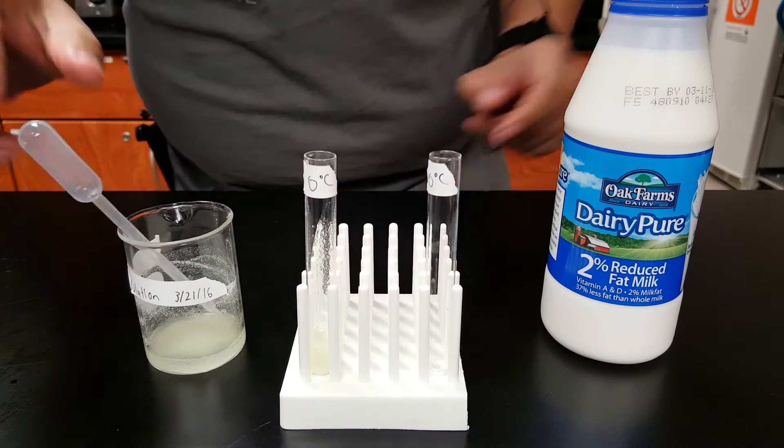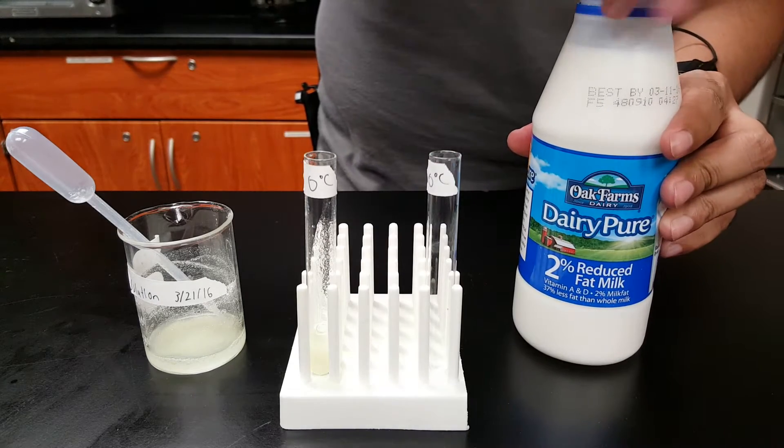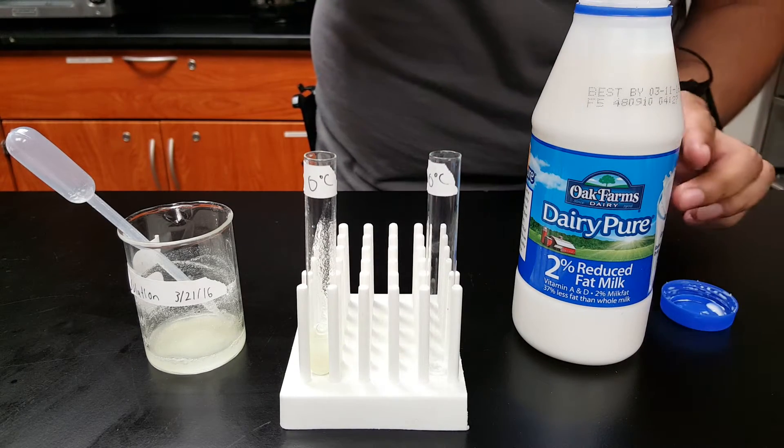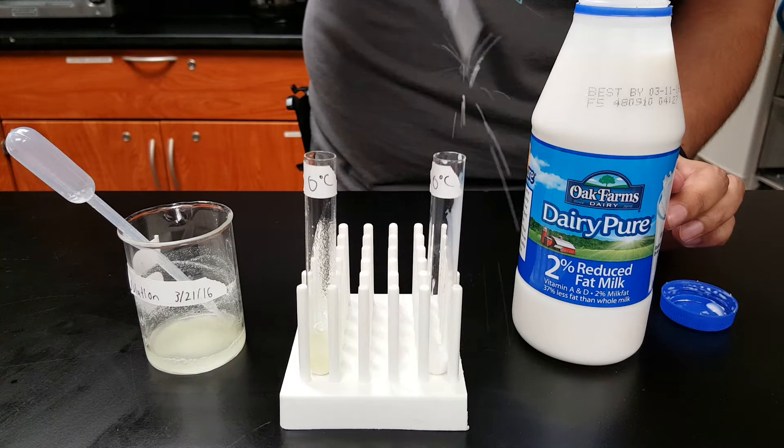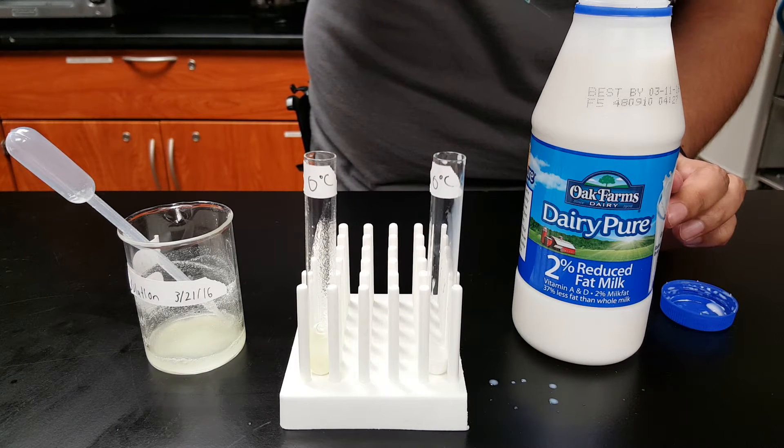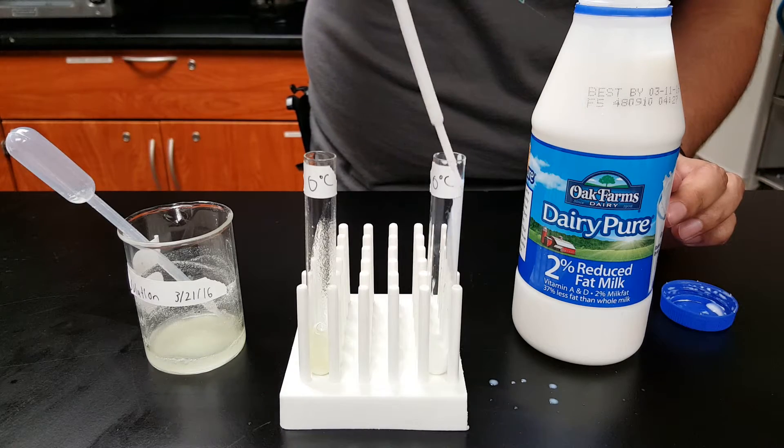In the second test tube, you take some milk and do the same thing, same amount, two milliliters.